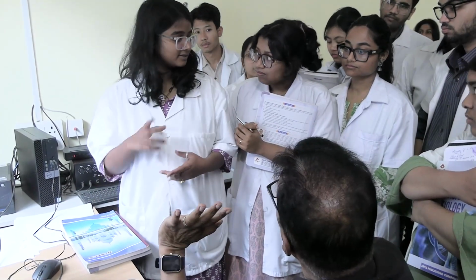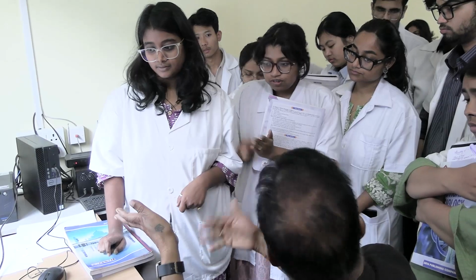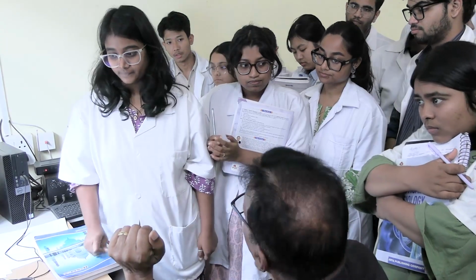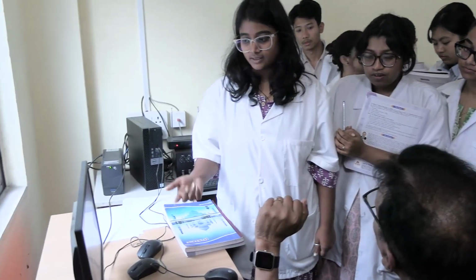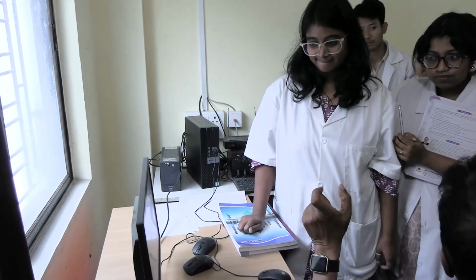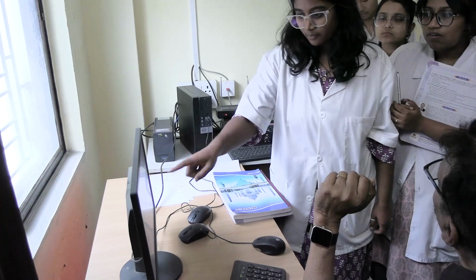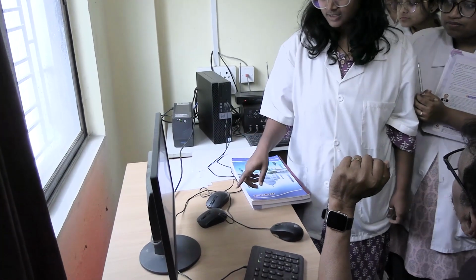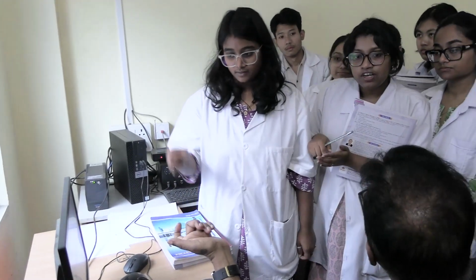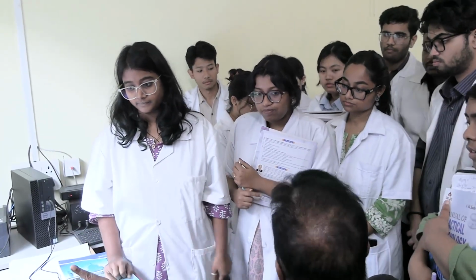We will first replace the ringer solution with the warm ringer solution. Earlier it was a normal ringer. Now I am putting warm ringer solution to increase the temperature of the muscle and the nerve. And we will wait for 1 to 3 minutes to allow the muscle to warm up. This reaction has to take place now, so that's why some time has to be given. Then we will use the same baseline, same point of stimulation and same strength of stimulus, and we record the effect of warm ringer. Fine. Thereafter, again normal ringer solution, then cold ringer solution. Then again you repeat this experiment, then the third graph you will get.